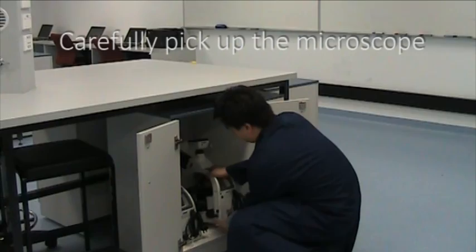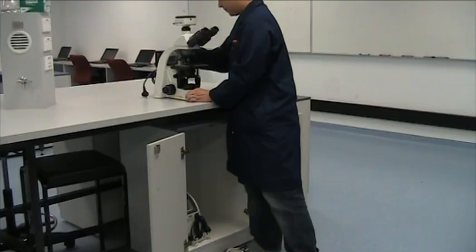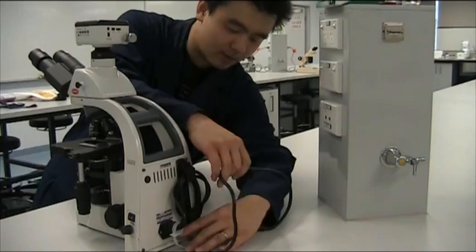First, pick up the microscope with both hands and carefully place it on the bench. Unwrap the power cable fully, plug the microscope in and switch it on.